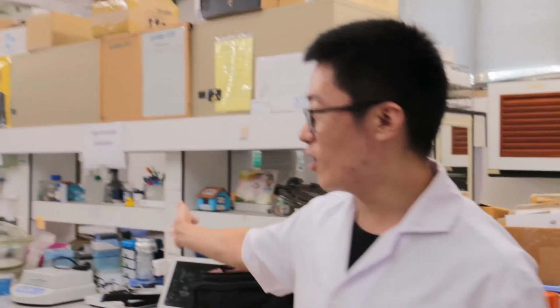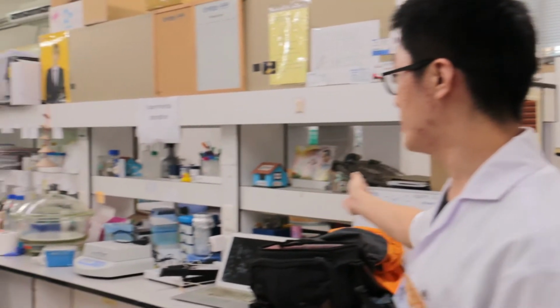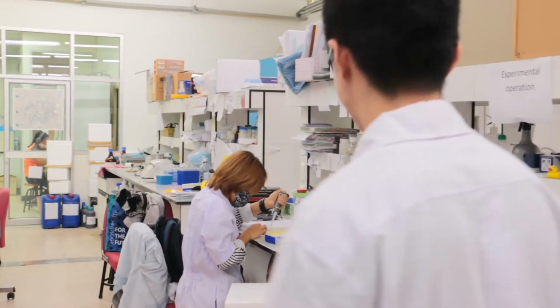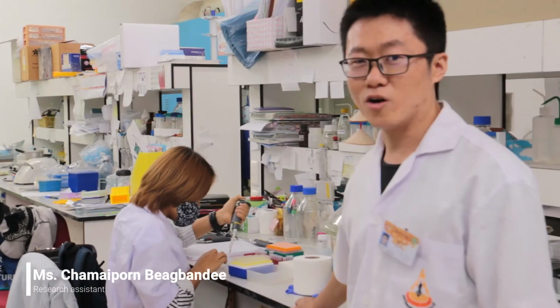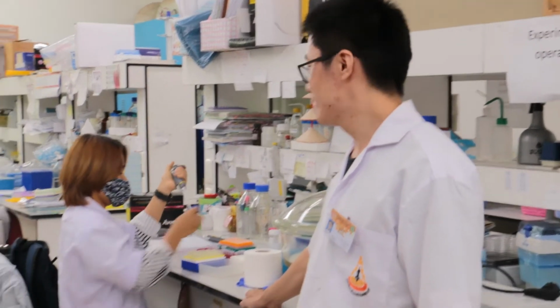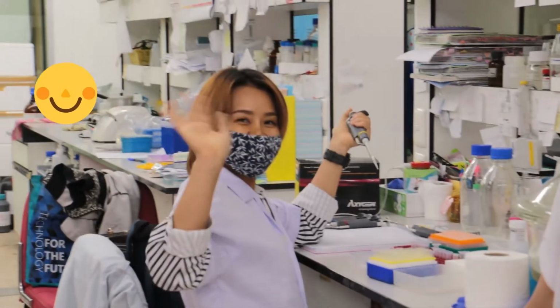This is our working bench, and we have the bottles, tubes, and some pipettes. Here's Miss Chamebon, our research assistant. She's doing the enzyme kinetics. Hello.